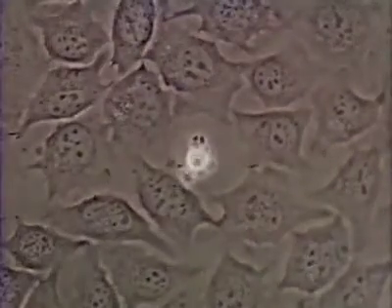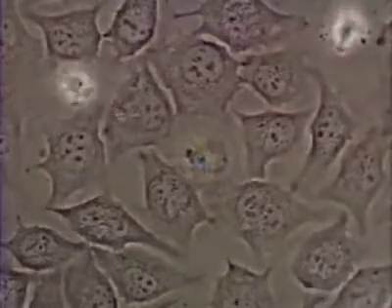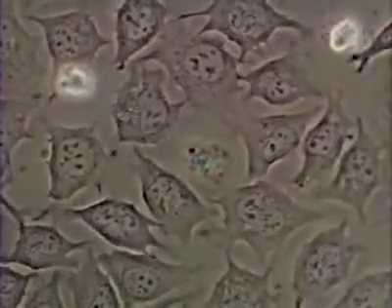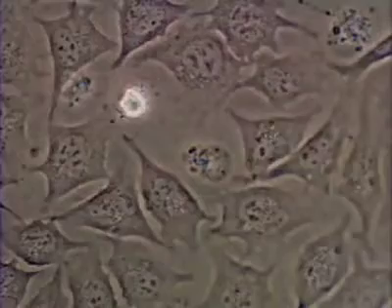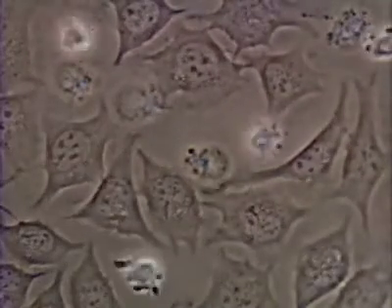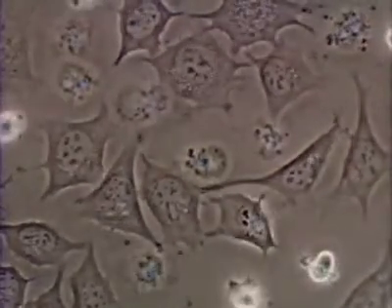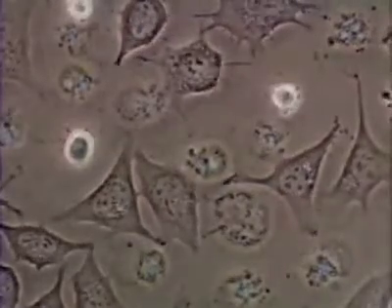Apoptosis, a form of programmed cell death, has been induced in these cultured cells. Cell death is characterized by blebbing of the plasma membrane and fragmentation of the nuclei. Cells weaken their attachment to the substratum they have been growing on and shrivel up without lysing.